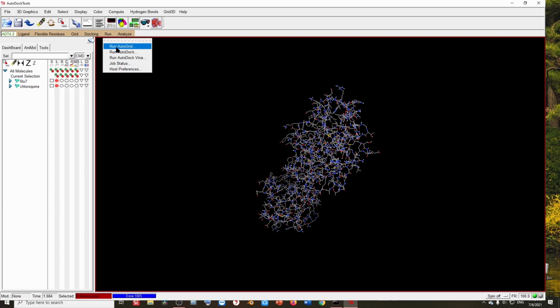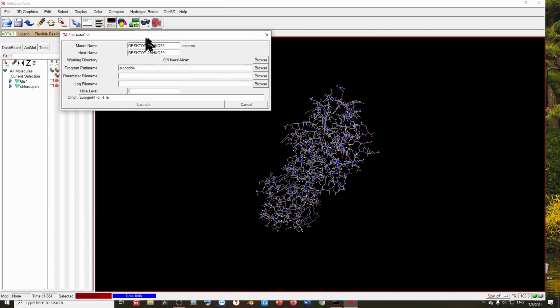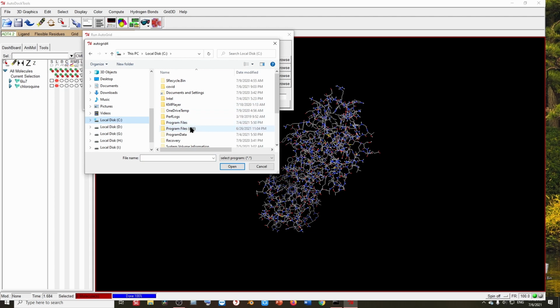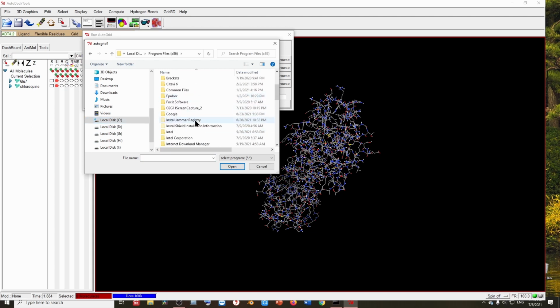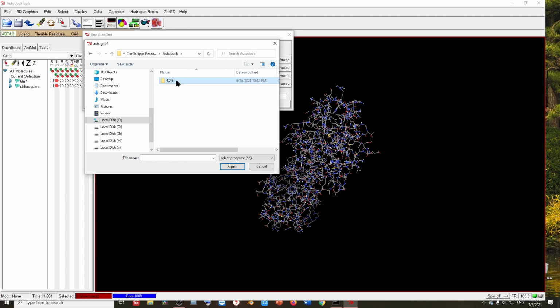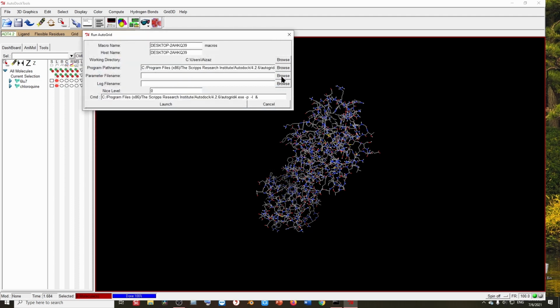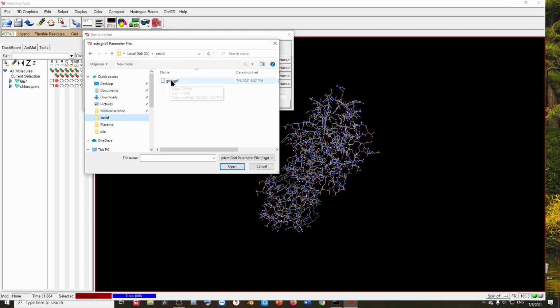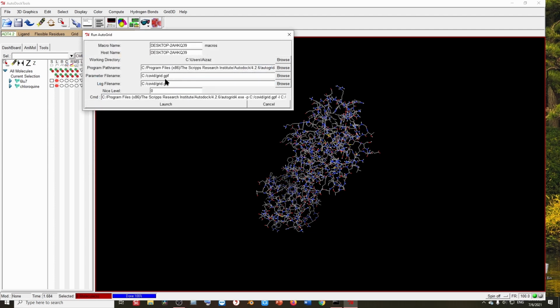So first let's run the AutoGrid. What we usually do is go to C, Program Files, and here I'm going to open the Scripps, this file. Here we usually select AutoGrid 4, right? And then in parameter files, here is my folder. Let's select this grid, and now let's launch the AutoGrid.